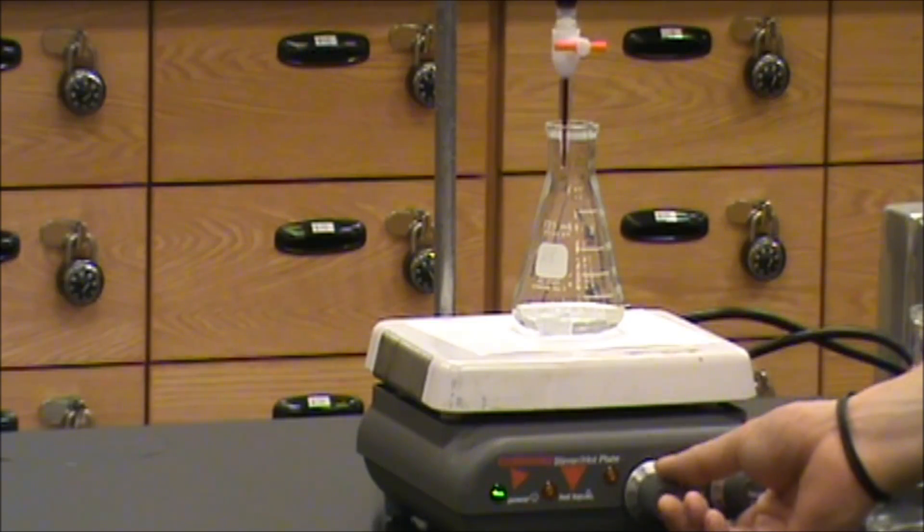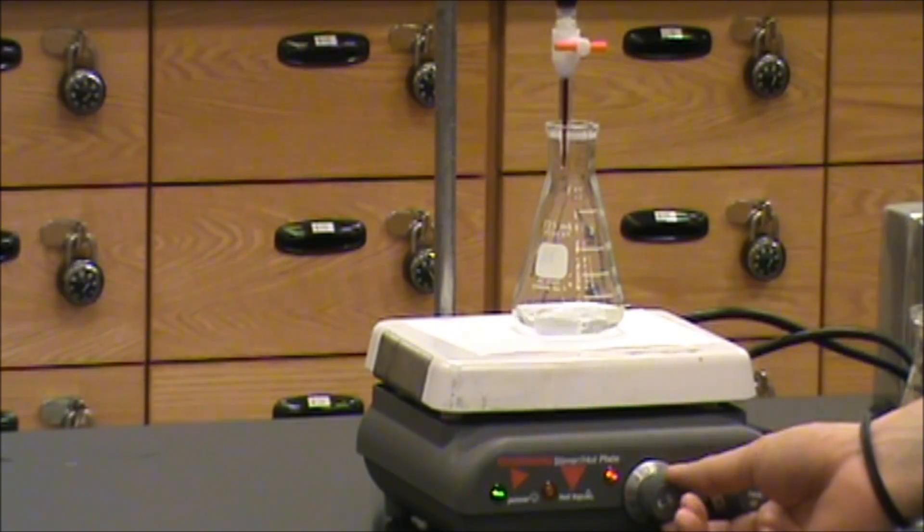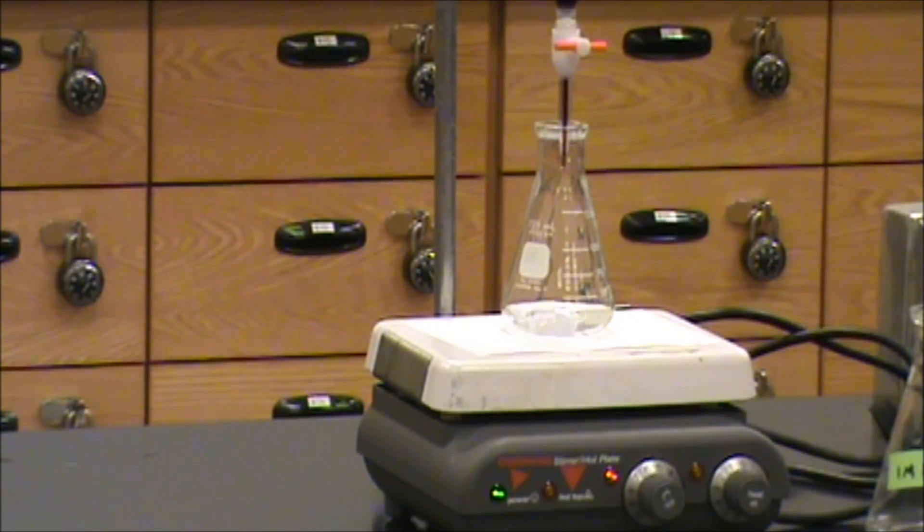It's time to turn on the stirring. We want a good rapid stir rate, but we don't want splashing to occur. That's pretty good right there.